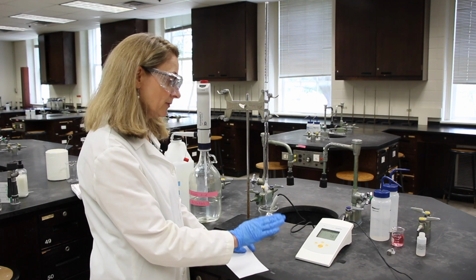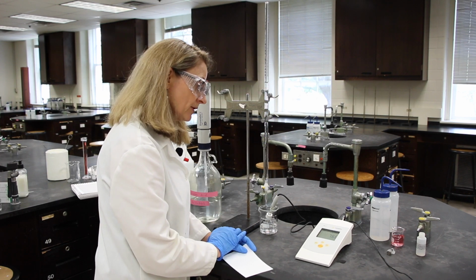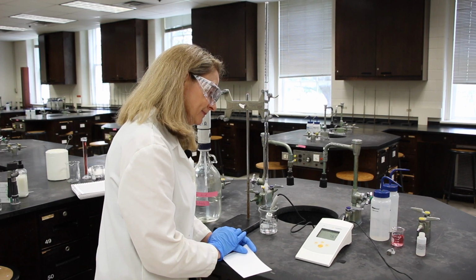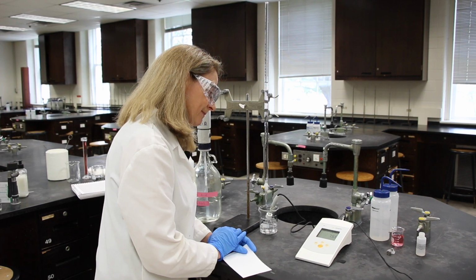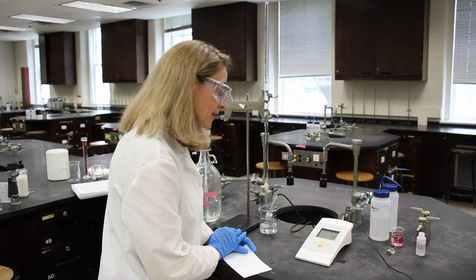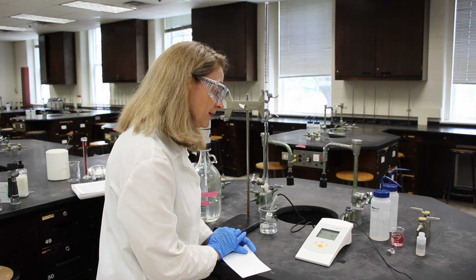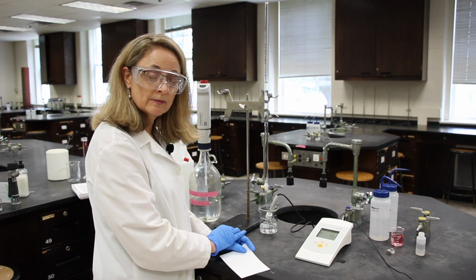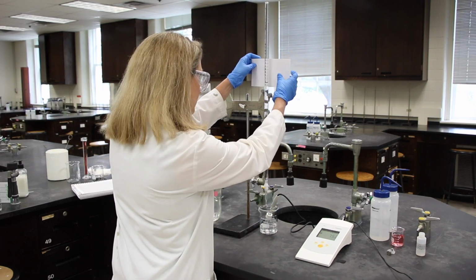You rarely hit it right at the equivalence point or right on the sharp jump of the curve. Okay. And it's stabilized at 7.54. That's 7.54. I'm going to drain another milliliter.